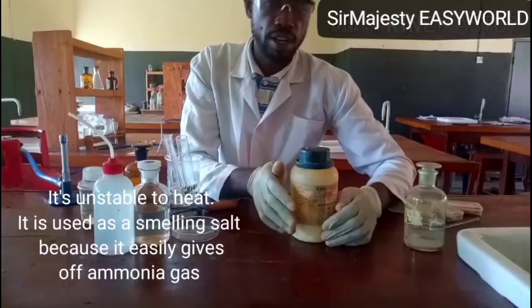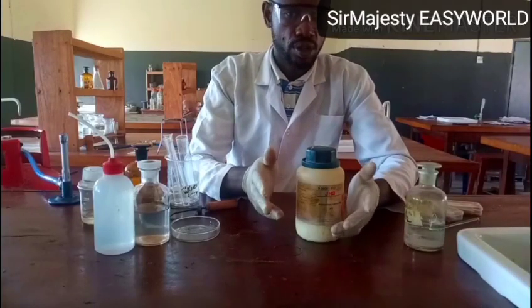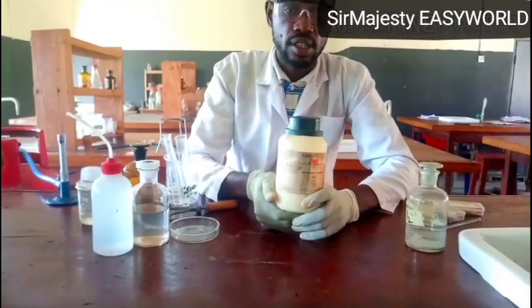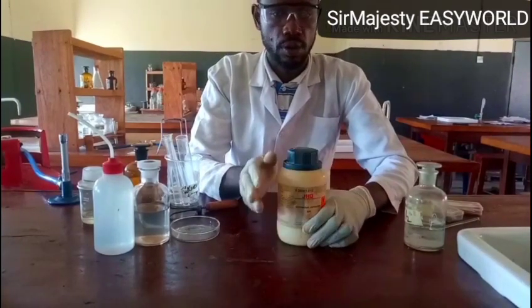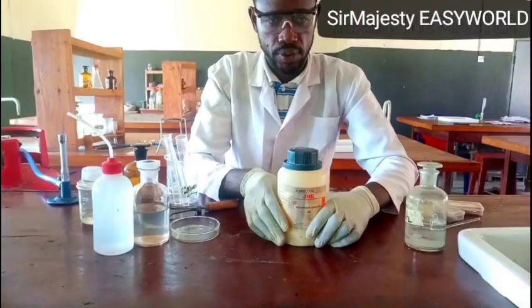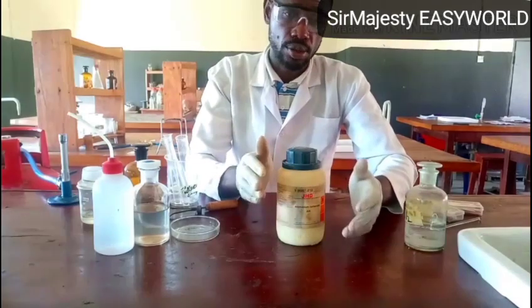So there are many ways or many approaches you will apply in the analysis. You might take these literary questions that you may have. You may be told that this is a C, and C is an inorganic salt. Carry out the following exercises on C. You write down the conclusion you draw from the results of each test, and you also identify the gas or gases involved from each of the tests you carry out.